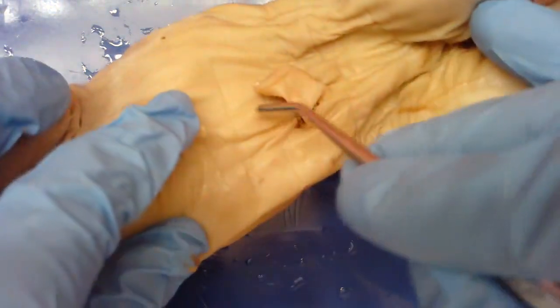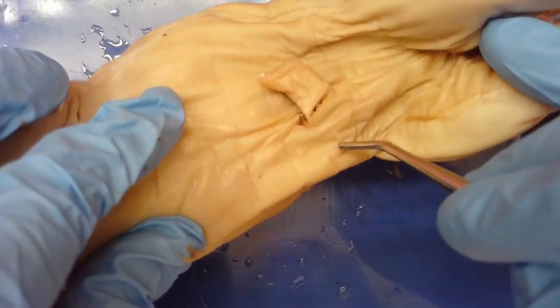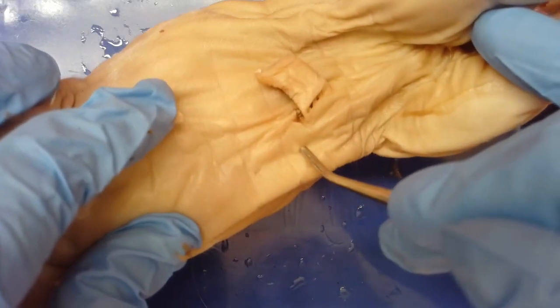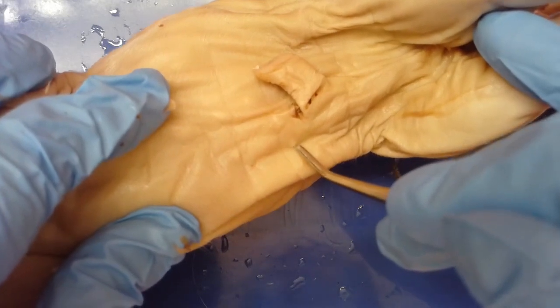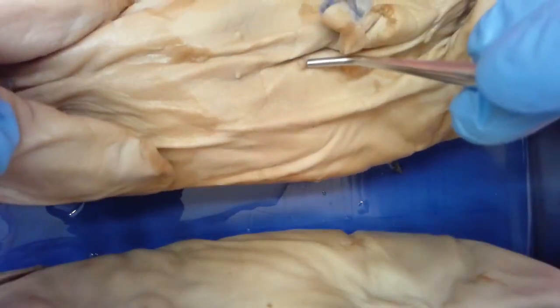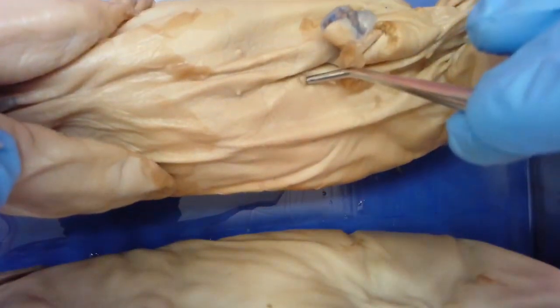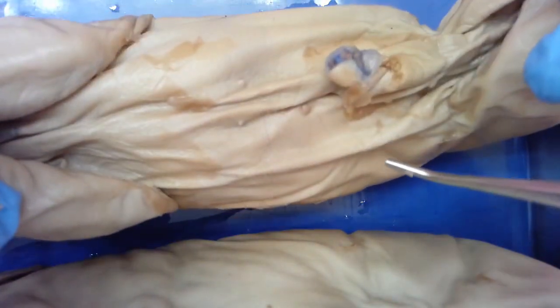You also notice on the stomach there are these little bumps — those are mammary papillae, similar to nipples in humans. In females, these would connect to mammary glands so that when this pig is old enough to nurse its young, it can provide milk for them. Switching briefly to our male fetal pig for comparison — you notice they also have mammary papillae. In the male, the mammary papillae are not connected to mammary glands, but they do have those external mammary papillae as well.